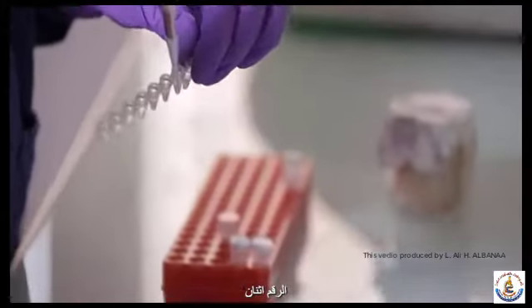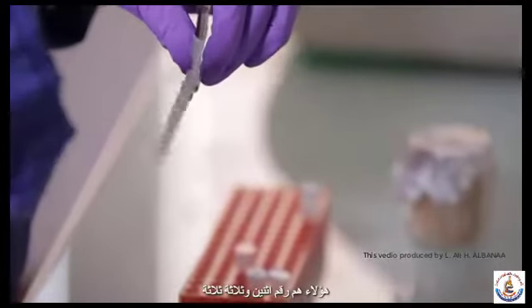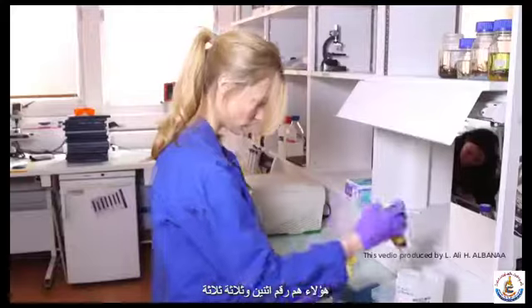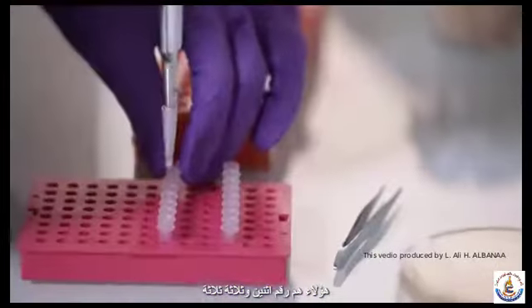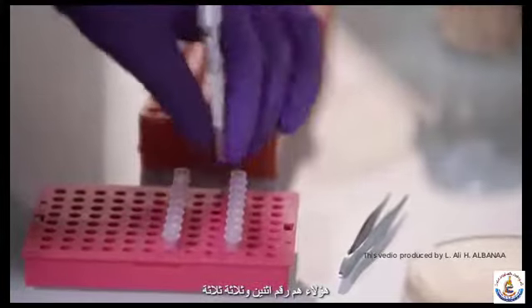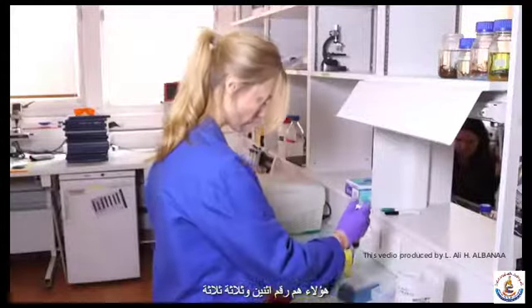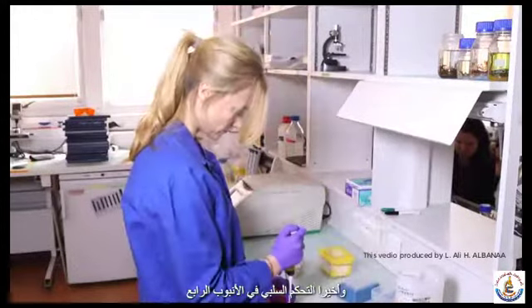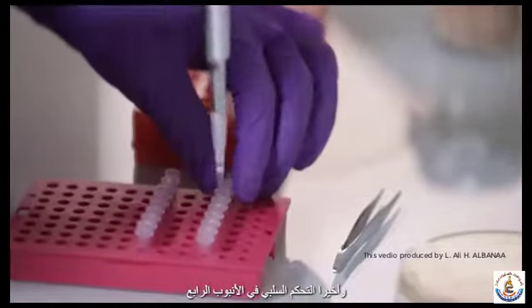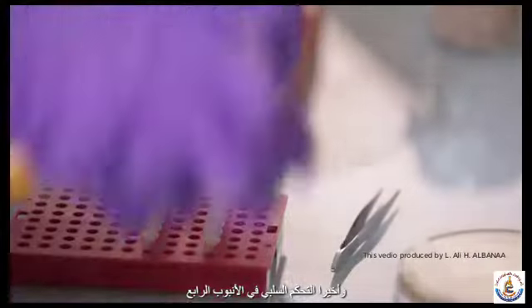Number 2 goes in number 2. Number 3, and finally the negative control in the 4th tube.